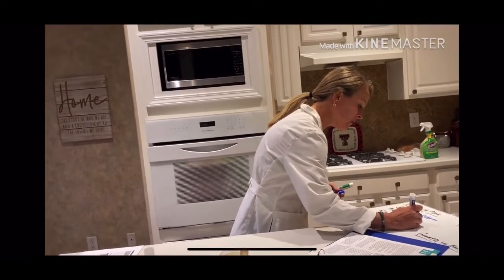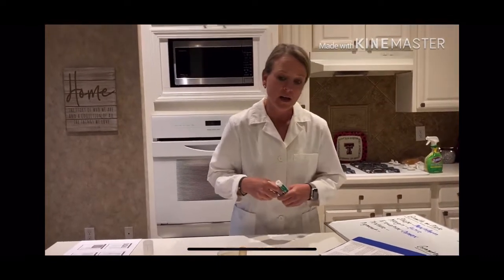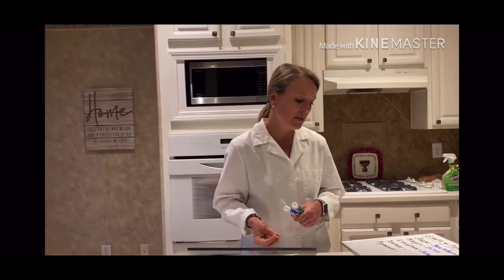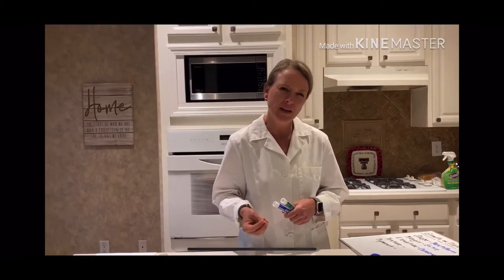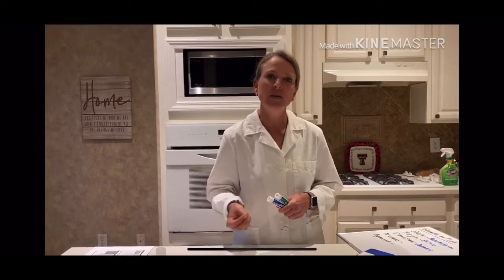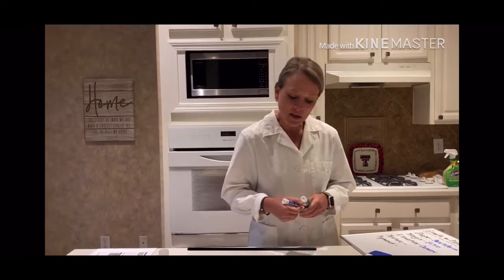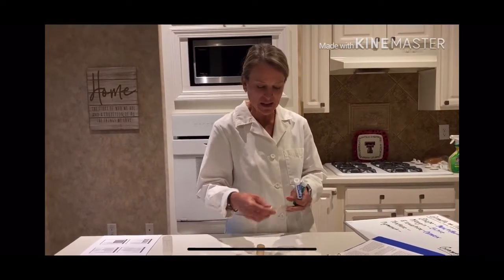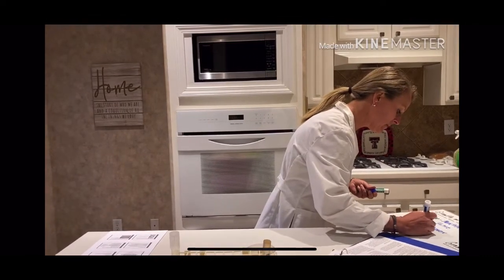So the next step would be for me to describe what the texture looks like, okay? Texture, of course, is going to be how it's growing on the plate. Is it going to be moist? Is it going to be mucoid, in that it looks kind of like mucus? Or is it really dry, kind of crusty looking? So I'm going to go with, again, looking at the organism, I'm going to say that it's pretty dry. So I'm going to go with it being dry in this case.